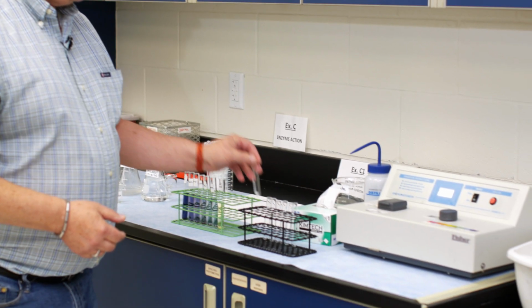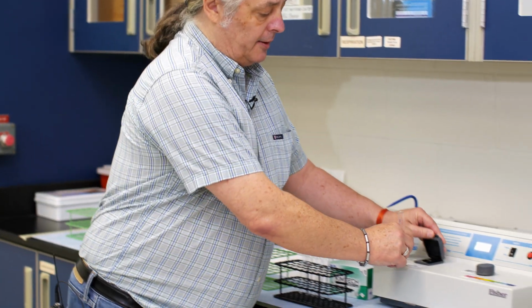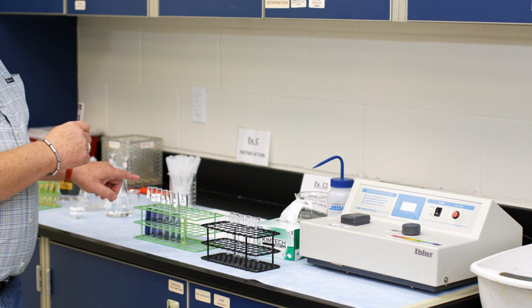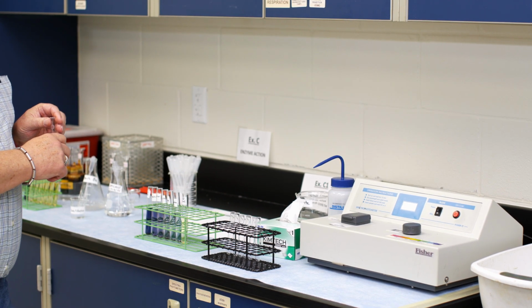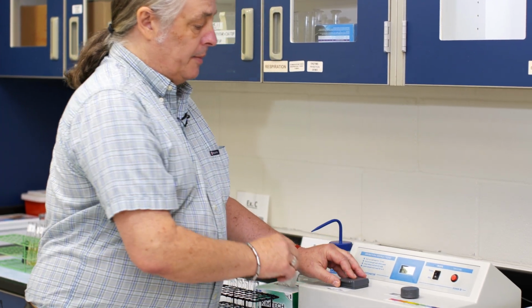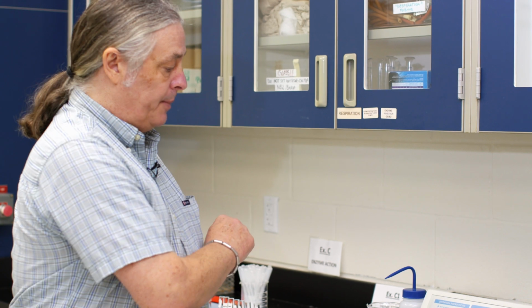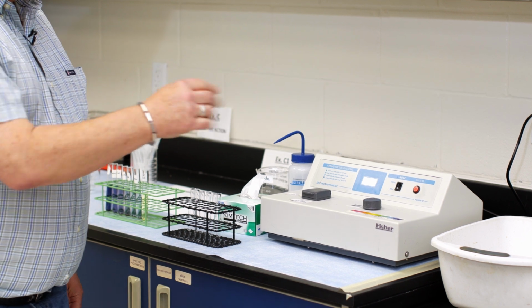What we'll do is take a sample in the small cuvette that will fit into the device of each solution of each time step that we've now prepared, and measure how much absorbance at the proper wavelength, I believe we're going to use 540 again, gets through that solution.